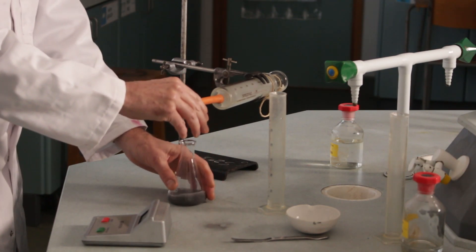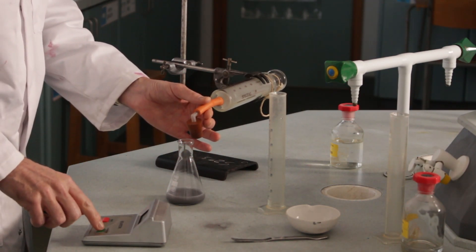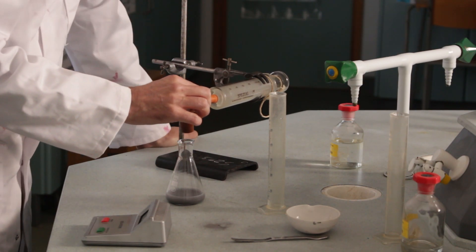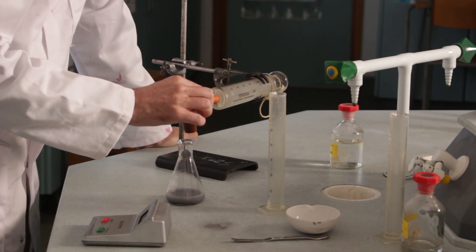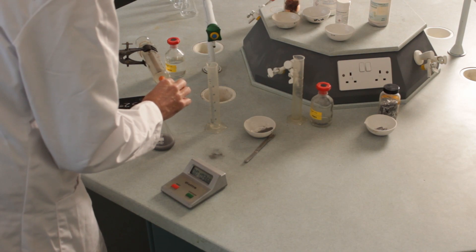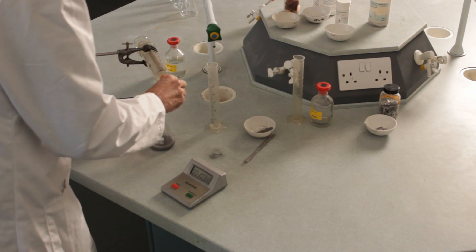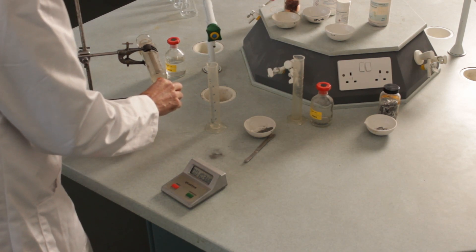So I'm going to pop the lid off there, stop the clock. Okay, and take a reading from this. So at the moment, this is reading 16 centimeters cubed of gas after a minute. And that was with very fine iron powder.